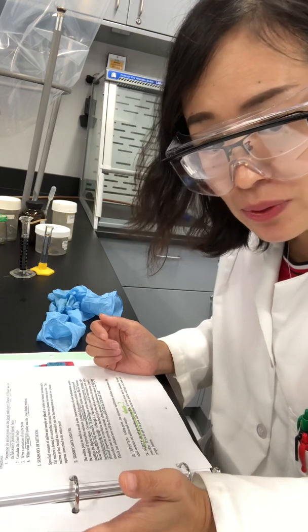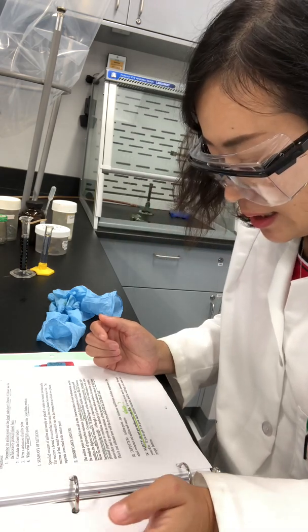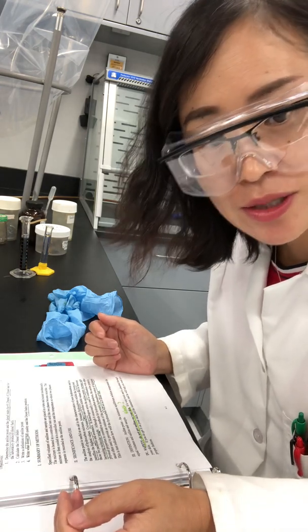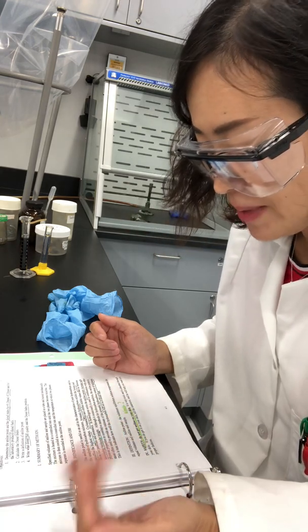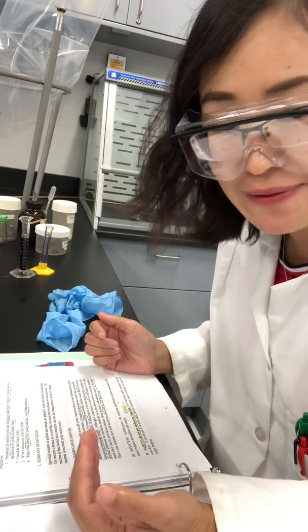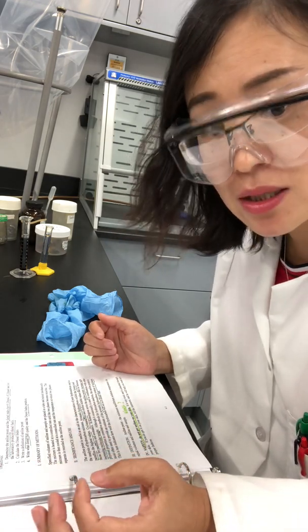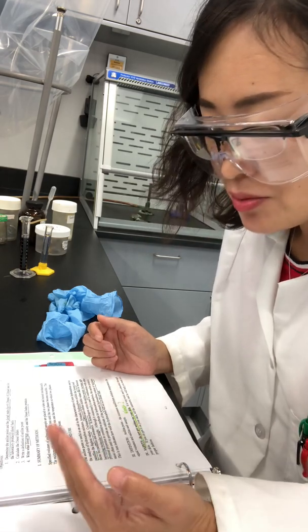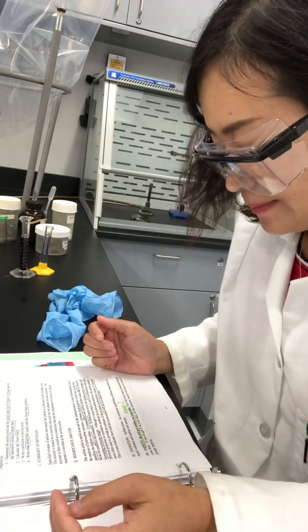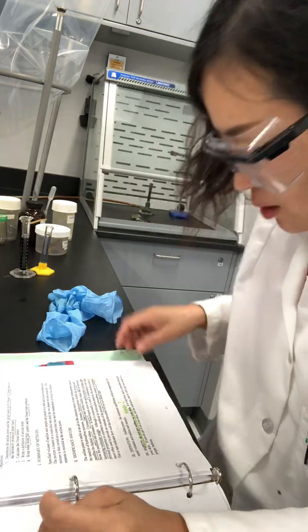And why do we need this aniline point? Because aniline point is a very important index that can give you an estimation of the aromatic hydrocarbon content in your fuel, because the aromatic hydrocarbons usually have the lowest aniline point, and the paraffins usually have the highest value. So based on the aniline point, you will have an estimation of how much aromatic hydrocarbon is in your fuel, and this in turn will indicate how well the hydrocarbon will act as a diesel fuel. Okay, so that's some background of the aniline point, and we're going to start the experiment.